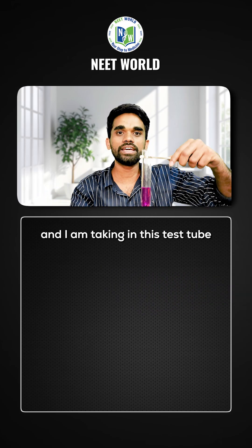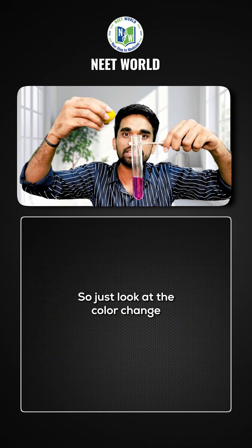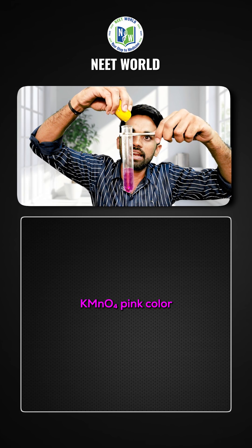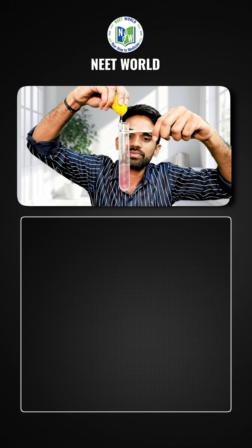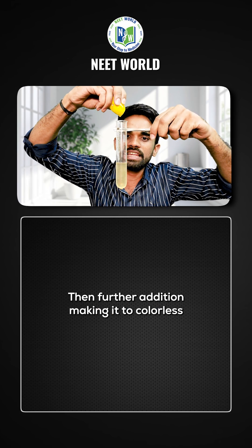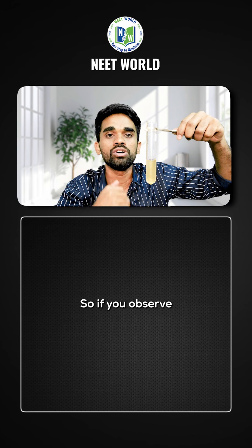Here I have KMnO₄ in a test tube, and I am adding lemon juice to it. Just look at the color change we are observing during this addition. The KMnO₄ pink color turns into some other color — look at this — the solution slowly converts into golden yellow, and then further addition makes it colorless.